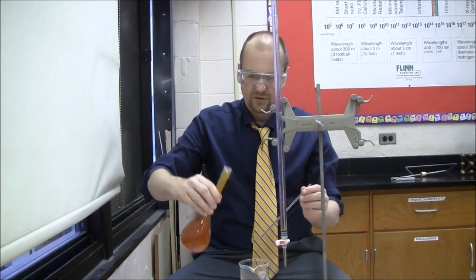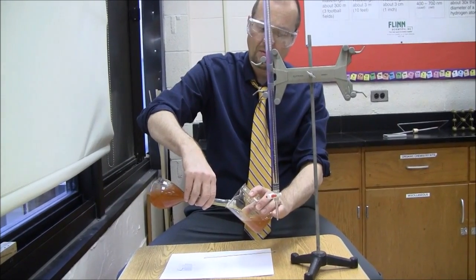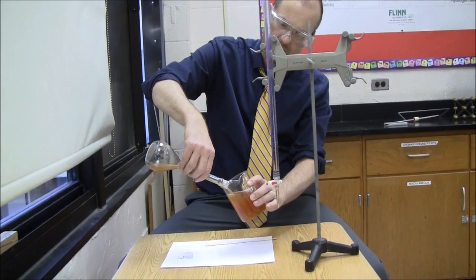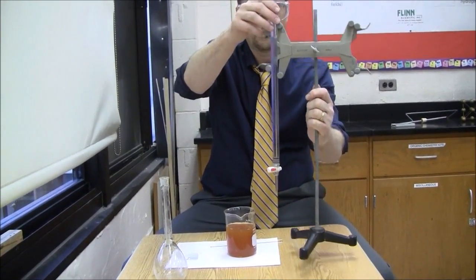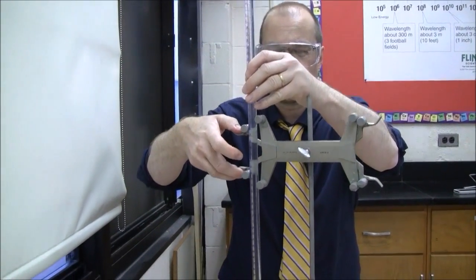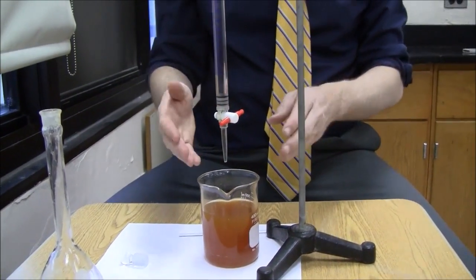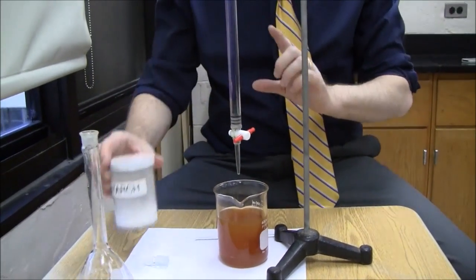Transfer your solution — we can't do a titration in the flask. It's pretty stable, but you don't want to aerate it more than necessary, although the chemicals added have stabilised the oxygen level. Now we're going to do a titration. This is sodium thiosulfate. Sodium thiosulfate is going to turn the brown I₂ iodine molecules into colourless iodide molecules. The transition from brown to not-brown isn't as obvious as you'd like, so when I get close to the end I'm going to add a little starch to sharpen the end point.